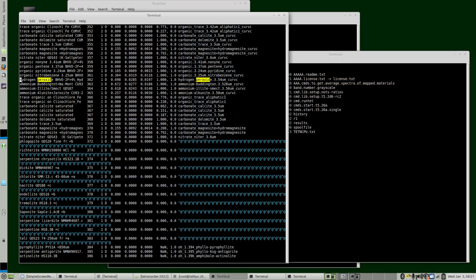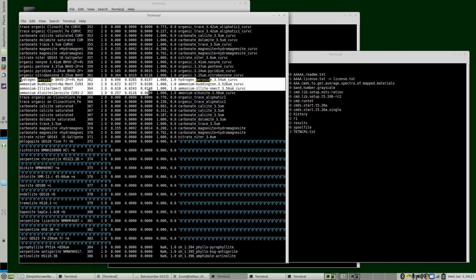This is another addendum. If we look at our mapping results from our last attempt, we saw that the fits were very close on 2 of them and not too far off on yet another. But notice also that the band depths, 0.02 or 0.028, are very weak. So one of the reasons why these fits are not 0.99 or so is because we're battling signal to noise with a very tiny band depth. And that's okay. But in either case, what we've learned is that the hydrogen peroxide 3.5 band occurs at a similar position with symmetry as ammonium bands.